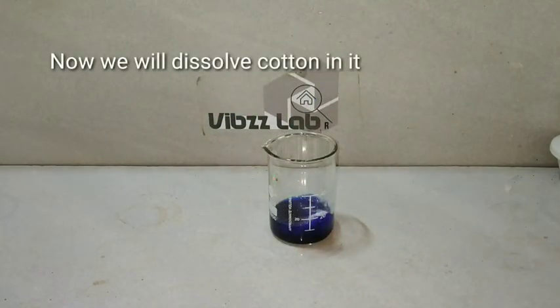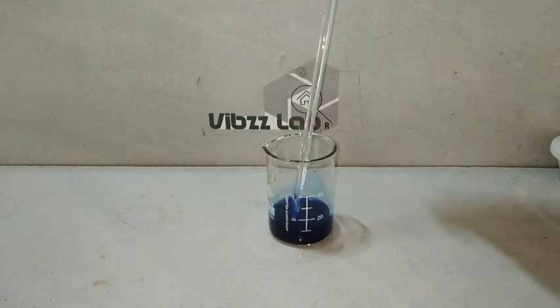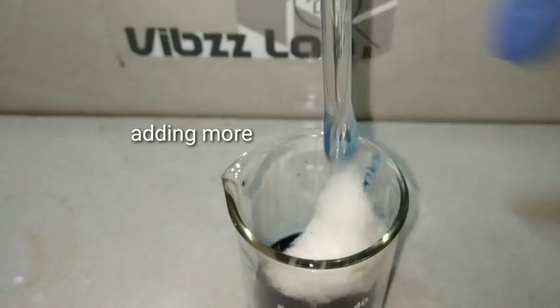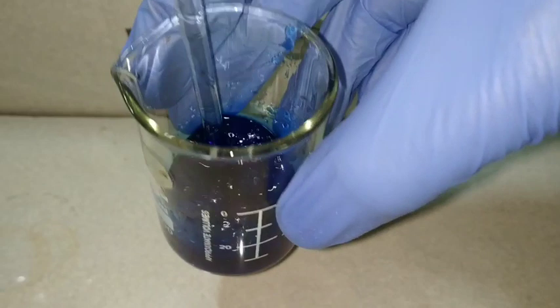This is our Schweitzer reagent and we will now see the dissolution of cotton into it. We have added a piece of cotton and we have mixed it well. You can see that Schweitzer reagent is dissolving more and more of cotton fibers and the solution is turning more and more viscous.